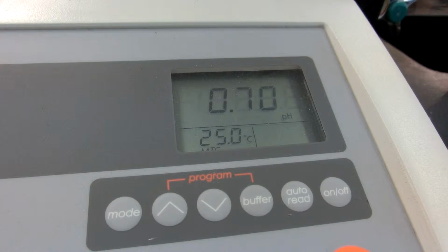You'll notice that in the first set of data, we ended up having such a flat plateau at the beginning where the pH really didn't change all that much, and then this huge spike in the middle in which we got really no resolution of detail of where things made the transition. It just jumped from really low up to really, really high.